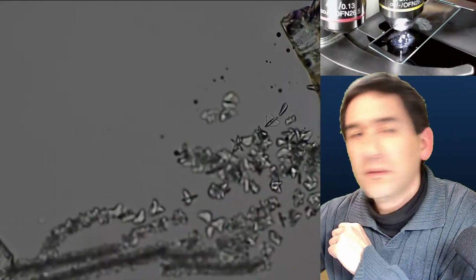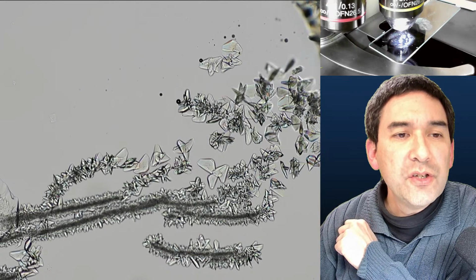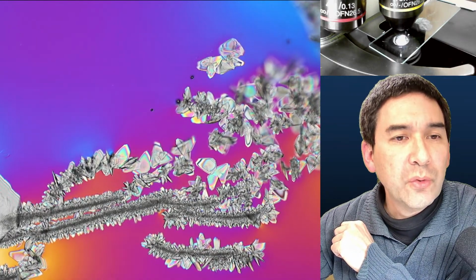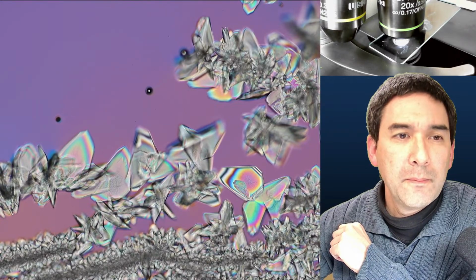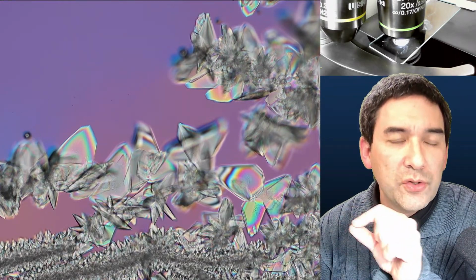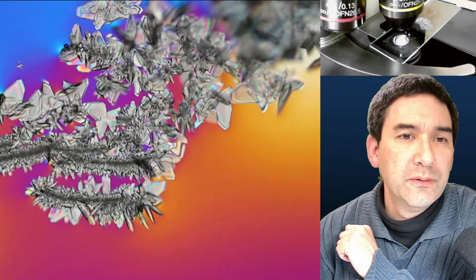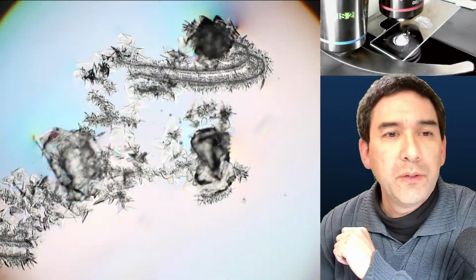And maybe, look. This acted as a crystallization seed, and now crystallization is actually starting again. So those crystals are now growing. Okay, again, slightly higher. Sometimes what is also possible is that you try to scratch a little bit the surface of the liquid, and sometimes this will also start to initiate crystallization. Looks also kind of pretty now. Yep. Here we go. In a lower magnification to get a better overview.